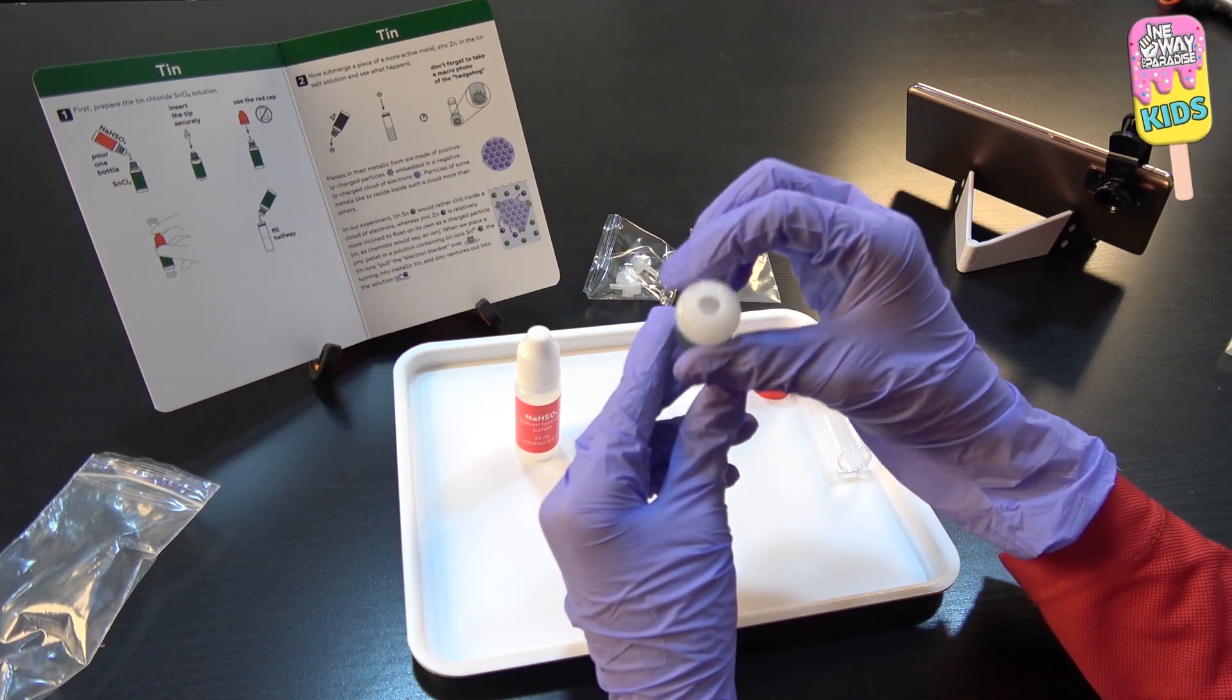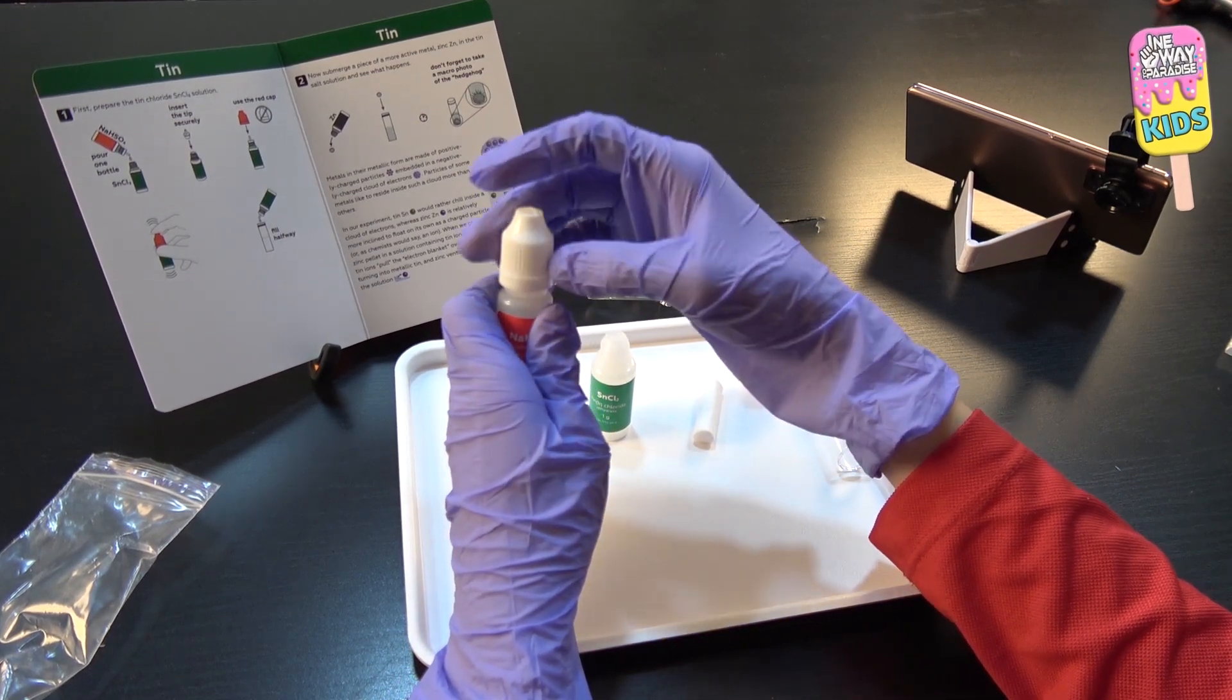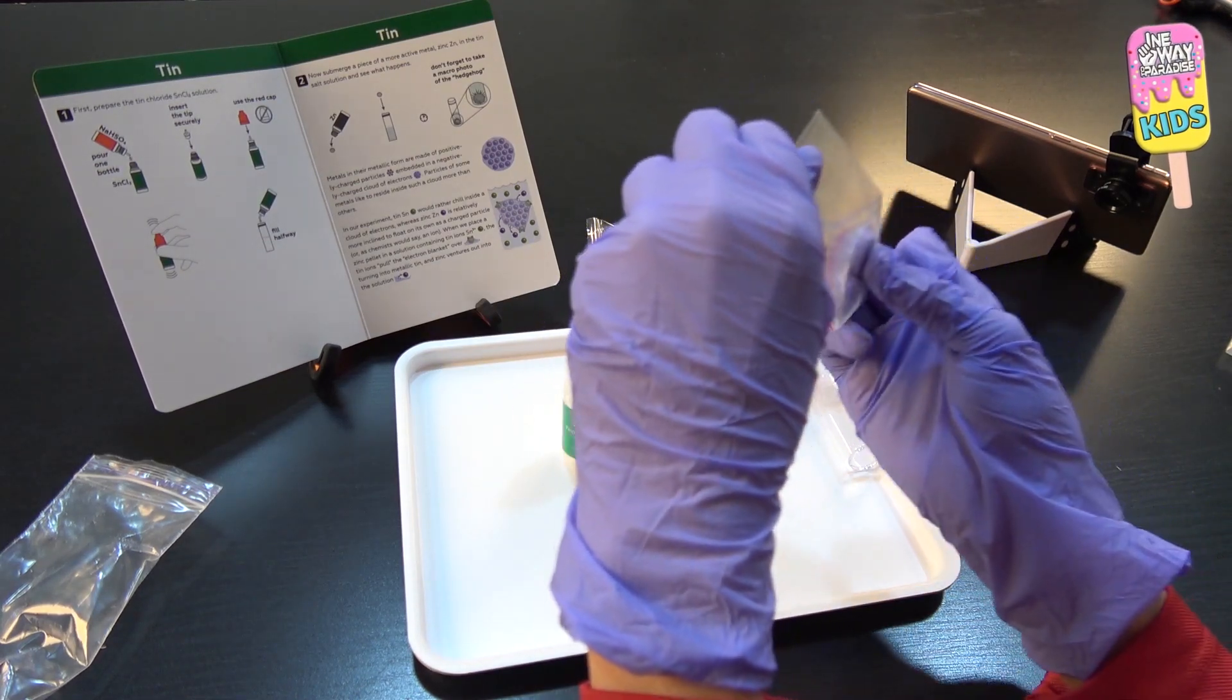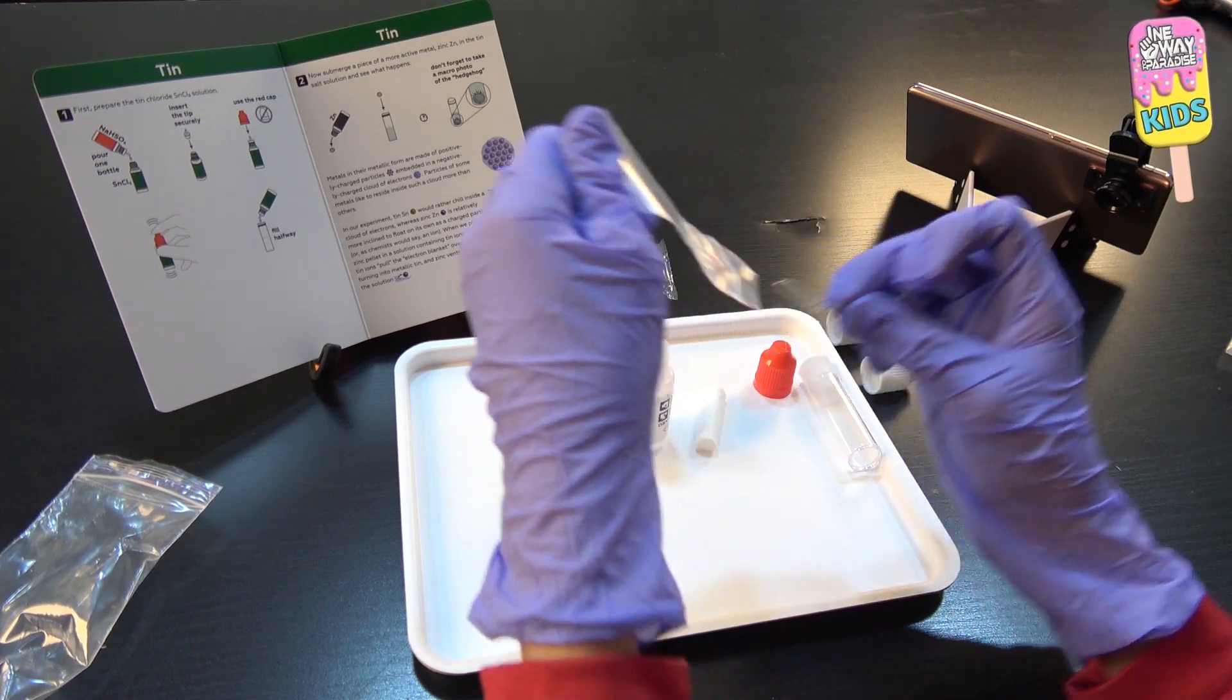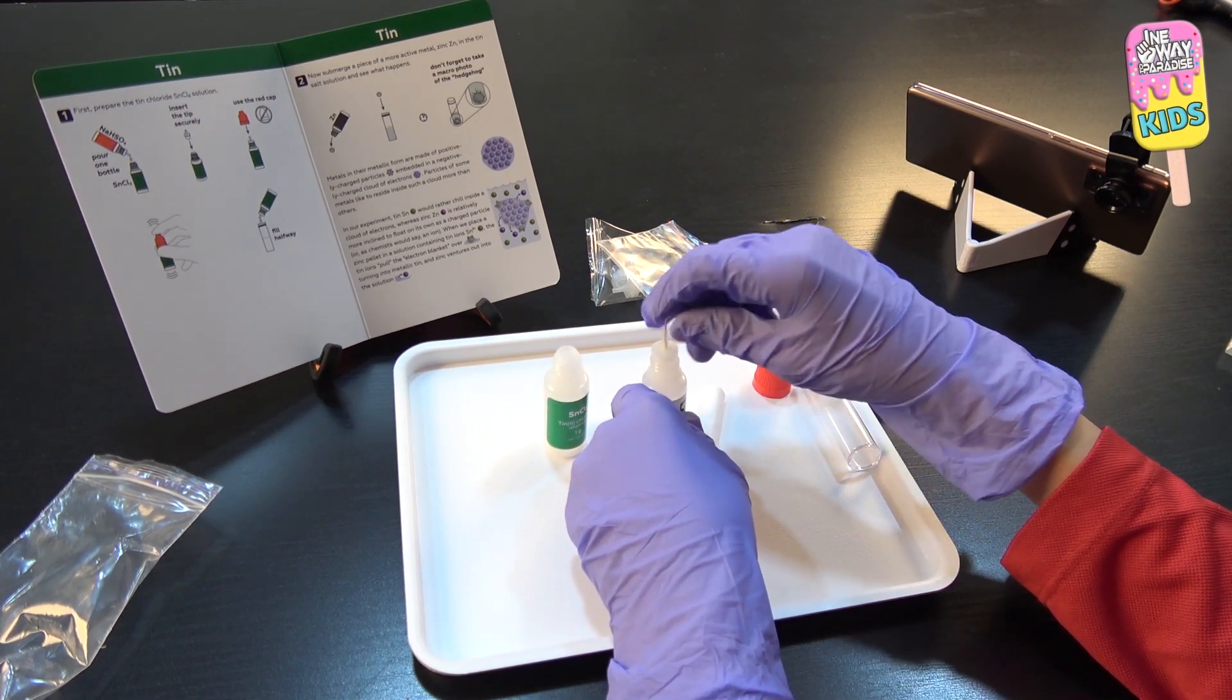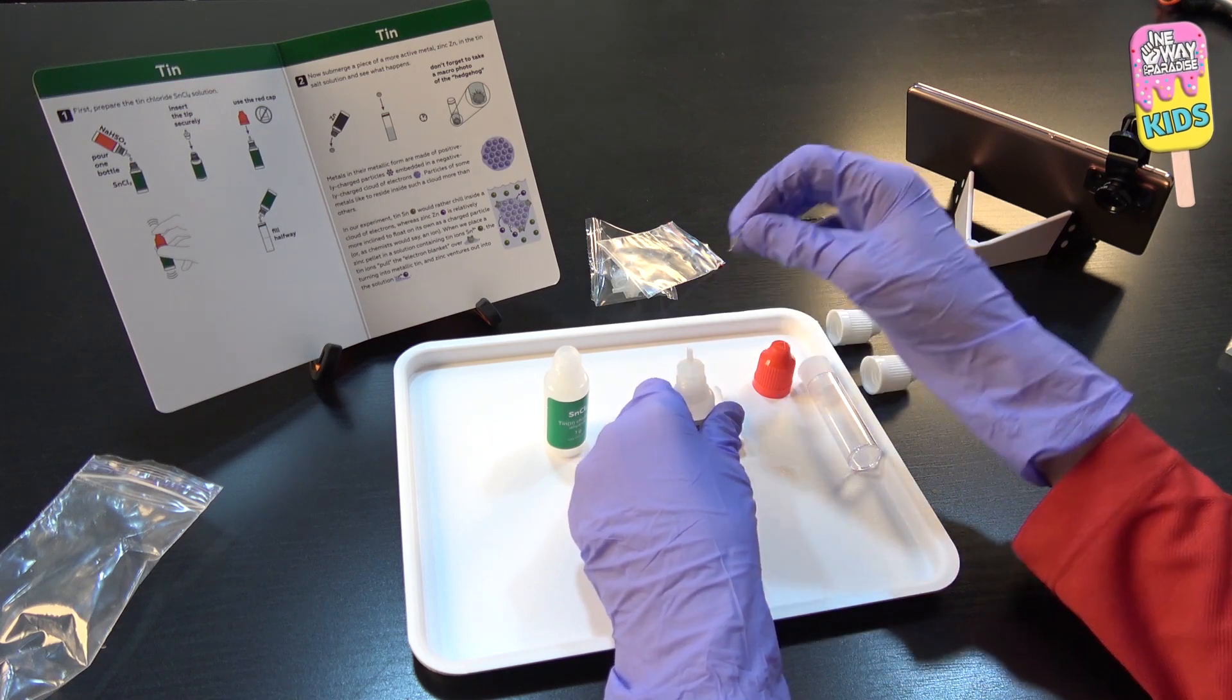There's some powder in there and I'll open this. First I need to remove that stopper which is inside using this pin. So I will just push this in. I hope that did it. There you go.